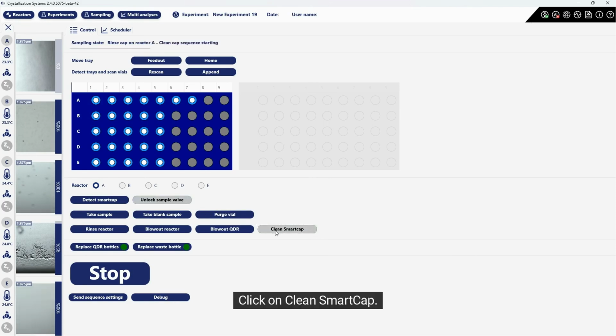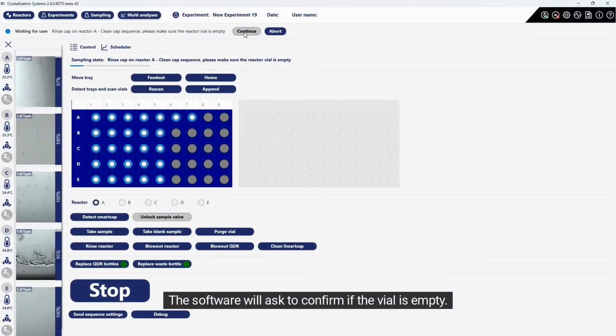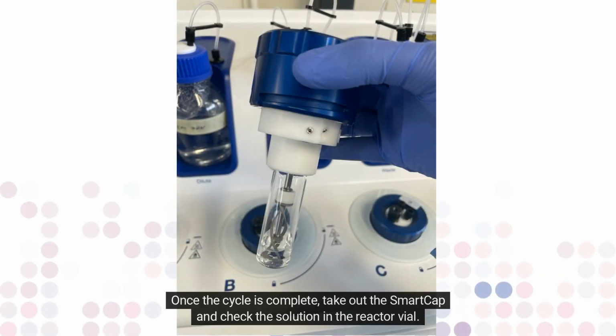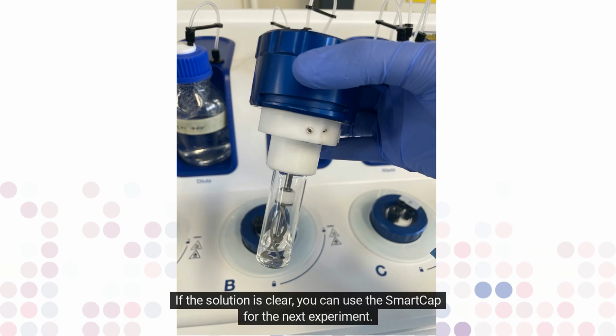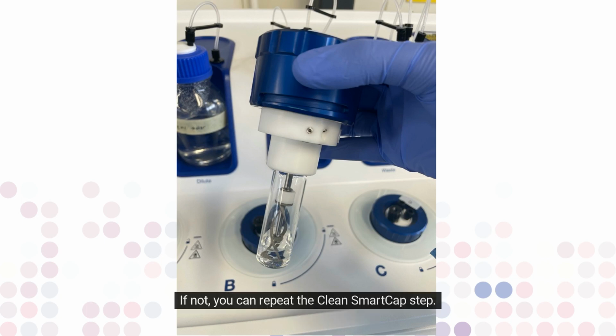Click on Clean SmartCap. The software will ask to confirm if the vial is empty. Click Continue. Wait for the cleaning cycle to complete. Check the status above in sampling state. Once the cycle is complete, take out the SmartCap and check the solution in the reactor vial. If the solution is clear, you can use the SmartCap for the next experiment. If not, you can repeat the clean SmartCap step.